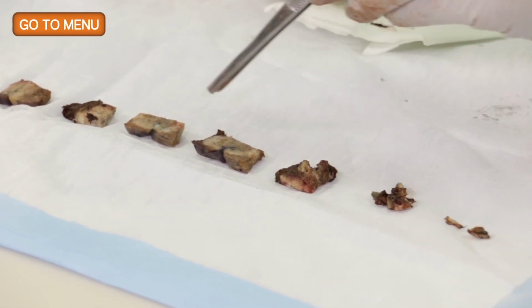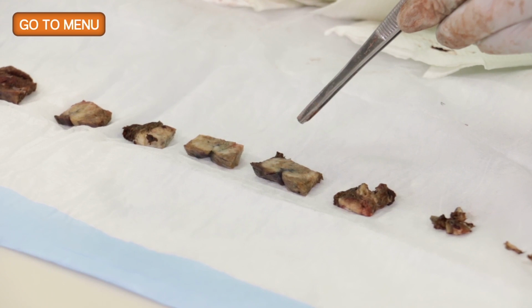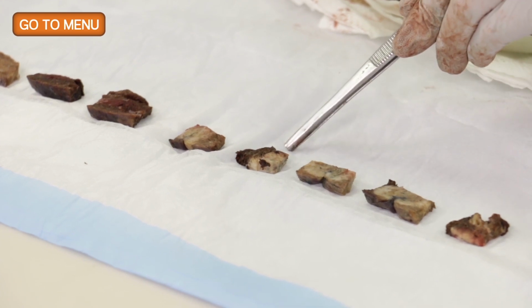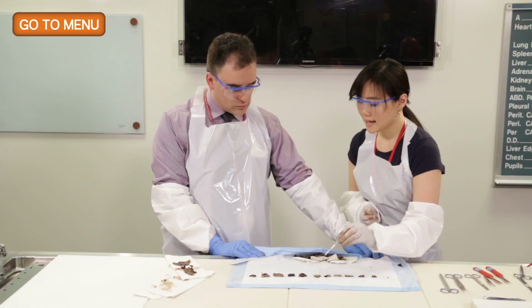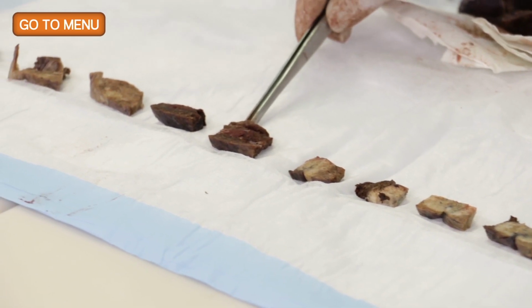Then we have 2 sections of full face of the tumor, as well as its involvement to the pleura. And over here we have 2 additional sections in which it has the tumor to the uninvolved normal lung. And of course, we found additional findings of possible hemorrhage, so we took 2 additional sections over here.